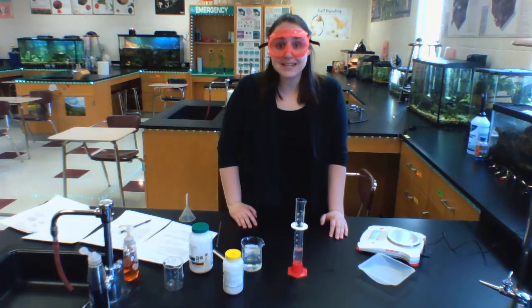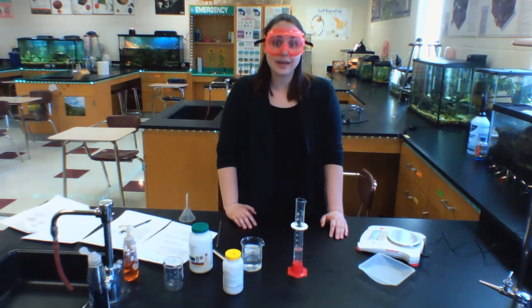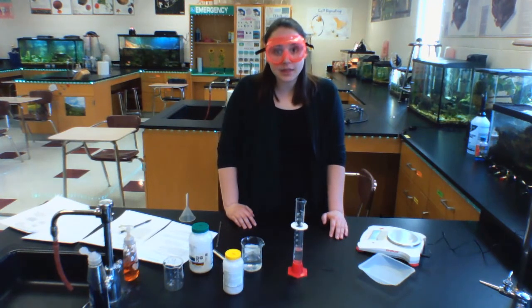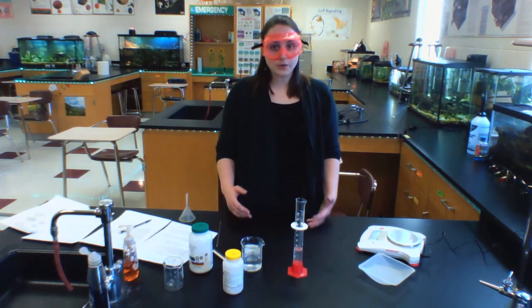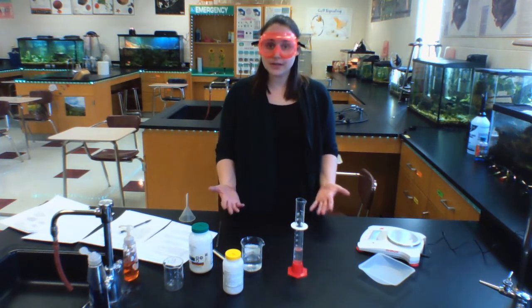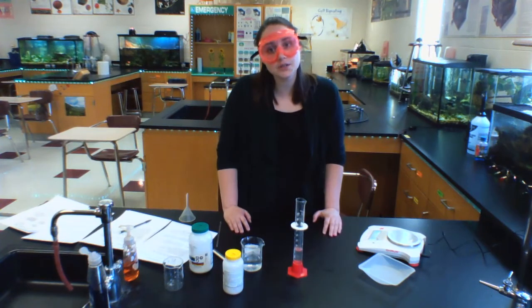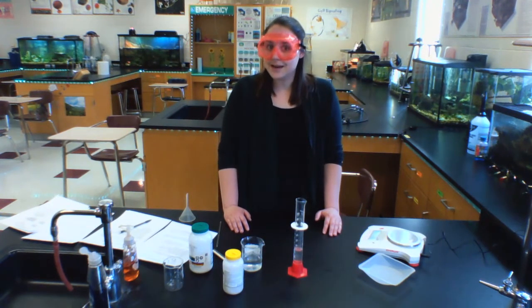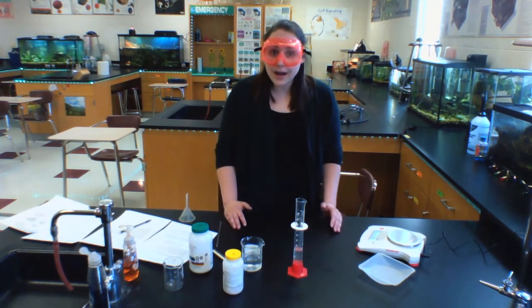Everyone, it's Larson in the lab, and today we're going to be looking at a stoichiometry lab. Today we're going to be beginning a 3-day long lab where at first we are going to have two materials that we are going to combine. Those materials we're going to combine for a reaction are called the reactants, and we are going to combine them today. And then tomorrow we're going to filter them, and then on the third day we are going to figure out the mass of our products.